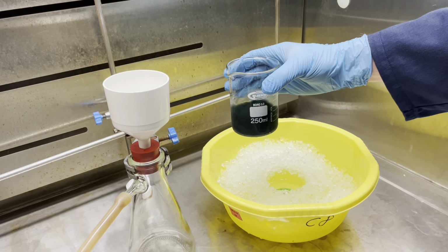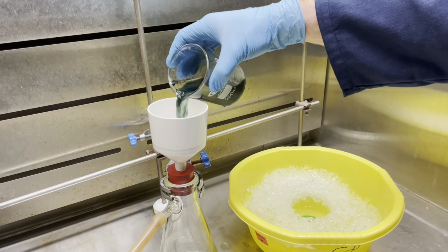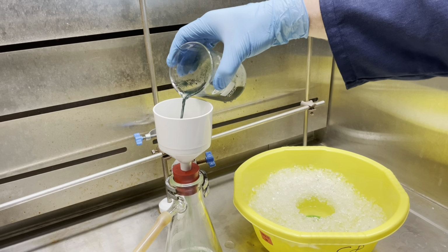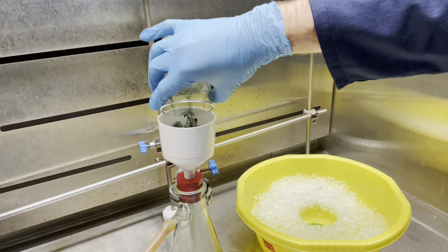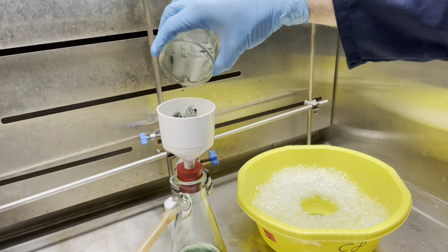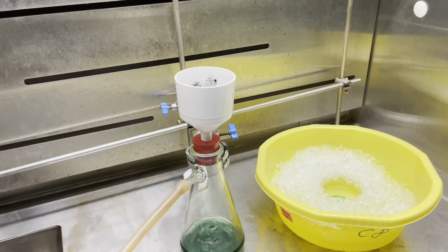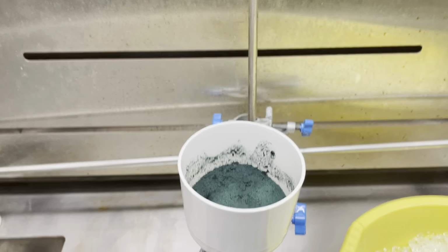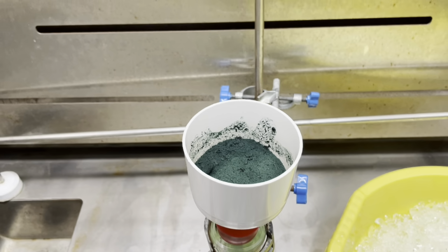After about 15 to 20 minutes of attempting to form seed crystals and allowing your product to crystallize, you can filter once again using vacuum filtration, hence your Buchner funnel and your filter paper. You can use a bit of heptane to transfer more of your product from your beaker to the Buchner funnel, should they be left in the beaker, but try to swirl and get as much as possible in your initial transfer to filter.